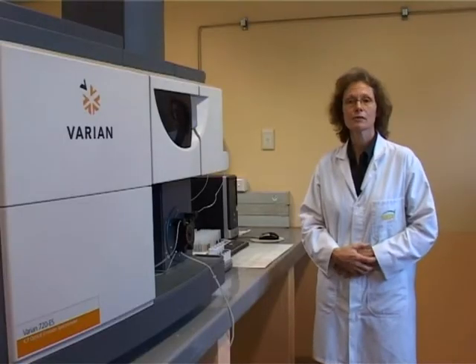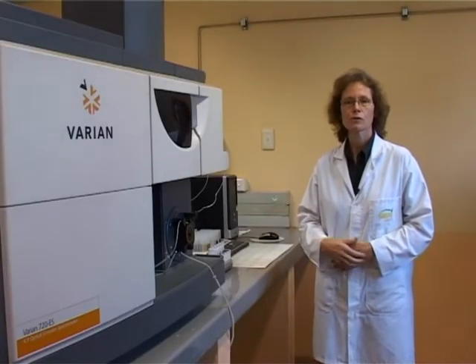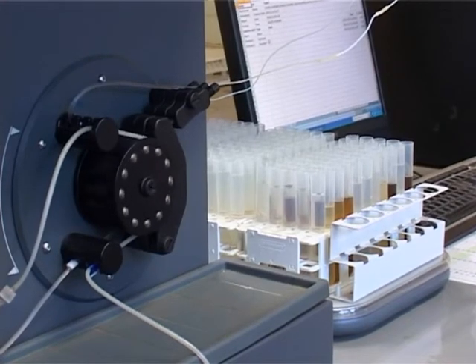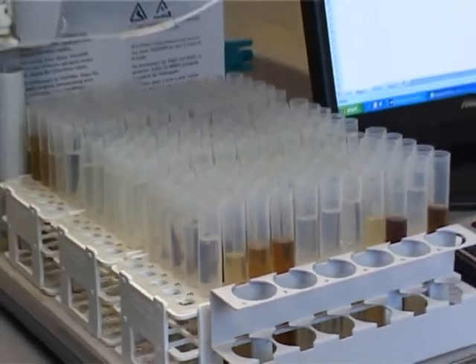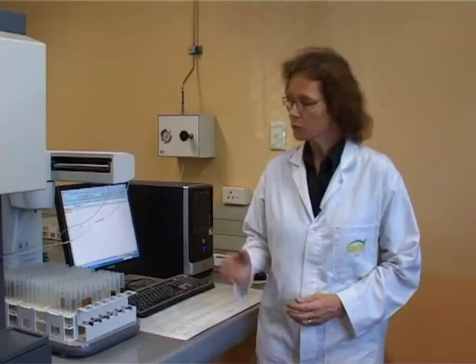This is another instrument room. The ICP is used to determine the macro-elements potassium, calcium and magnesium. The micro-elements zinc, iron, manganese and copper are also analysed. These micro-elements are now included as part of the routine analysis package. The use of the auto-sampler allows us to run the ICP overnight, thereby increasing our capacity further.